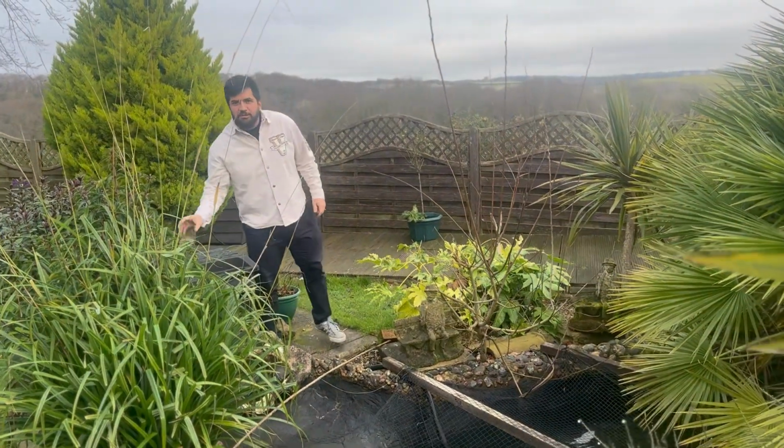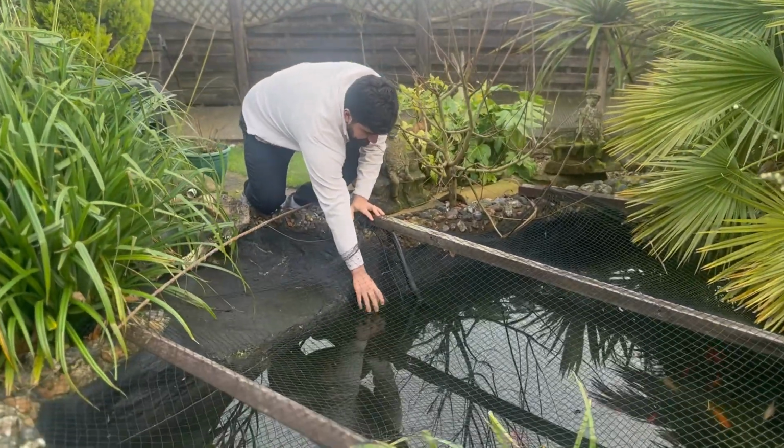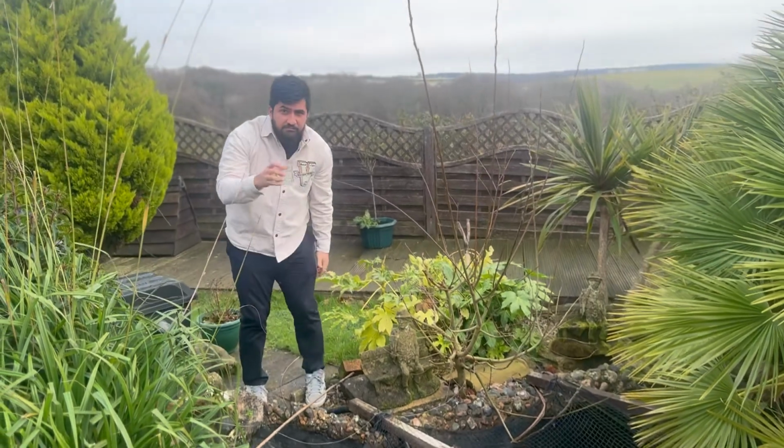Let's take a look at some pond water. Let's go.